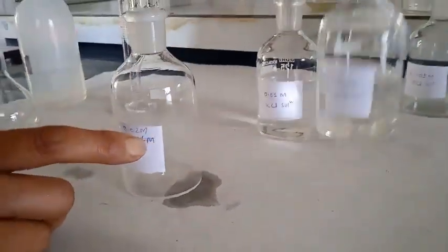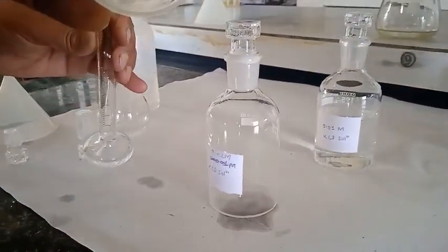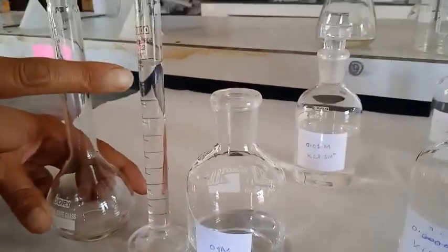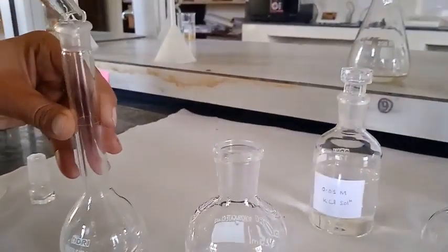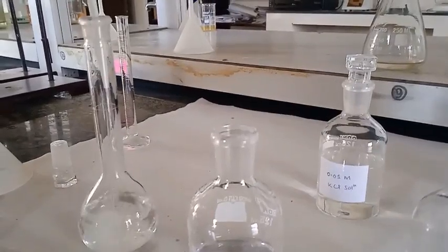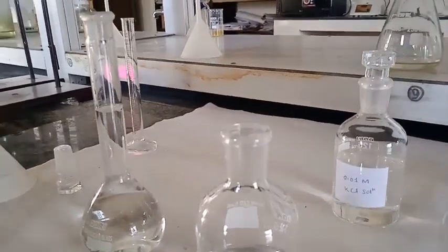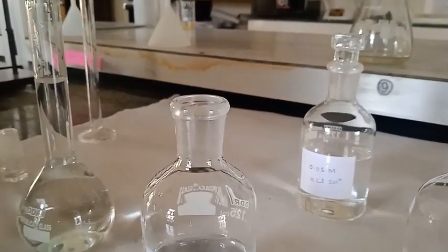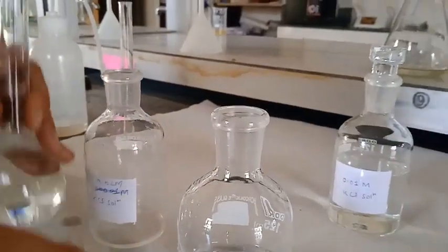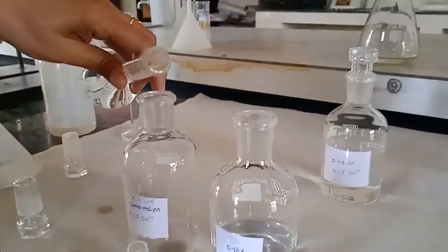Now I am going to prepare 0.02 molar. I will take 20 ml of the 0.1 molar solution and dilute it up to 100 ml. I have transferred 10 ml already into this measuring flask and 10 ml again. If you use a 20 ml pipette that would be better because chances of error are less. I make it up to 100 ml and then transfer it again into the reagent bottle after mixing thoroughly.